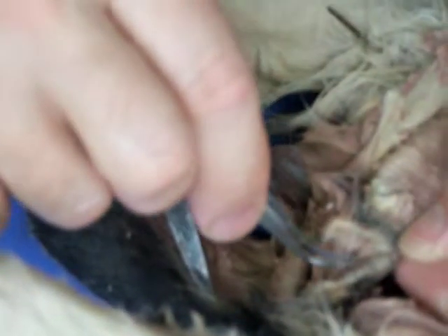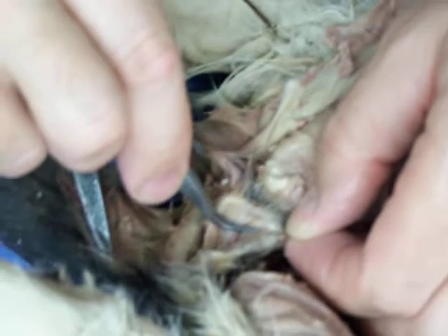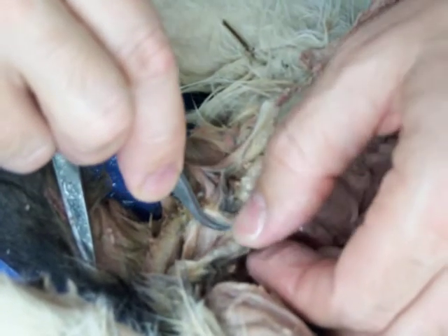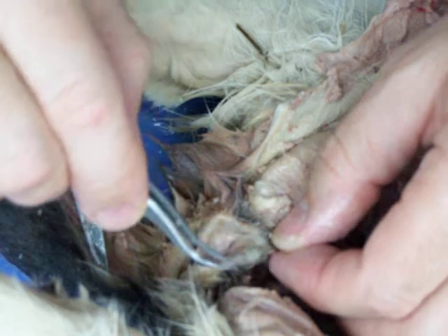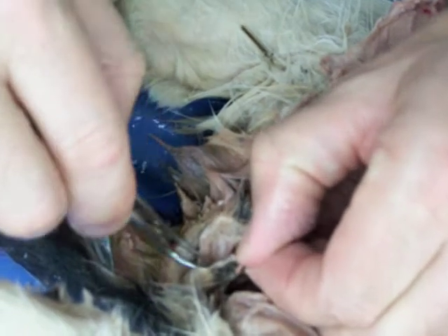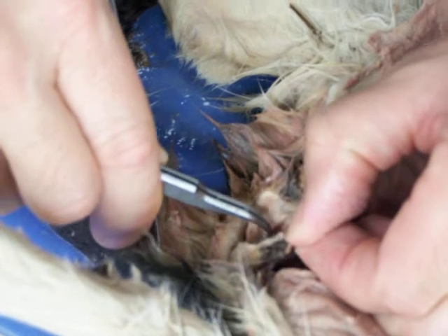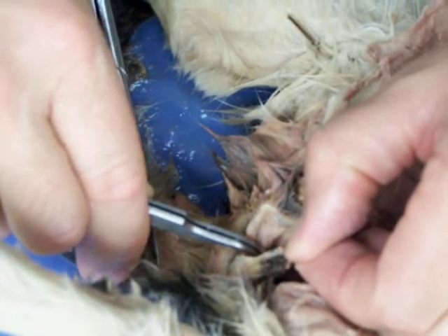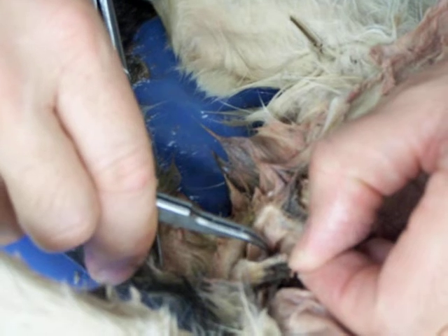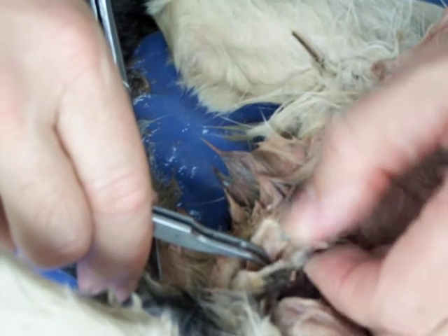And unfortunately, the clitoris is right in the midline, and it would be right in here. And this isn't real clear. It's difficult to see in a cat. It's really tiny. And you can't see it where you are, but you can come by and see the opening of the vagina is pretty large in here. And the tip of the forceps are back in that opening now, which is unfortunately filling up with fluid.